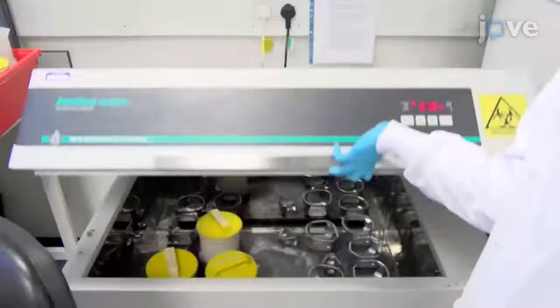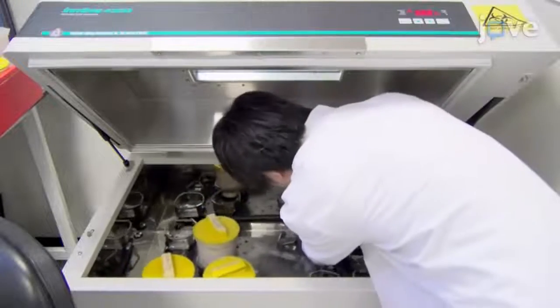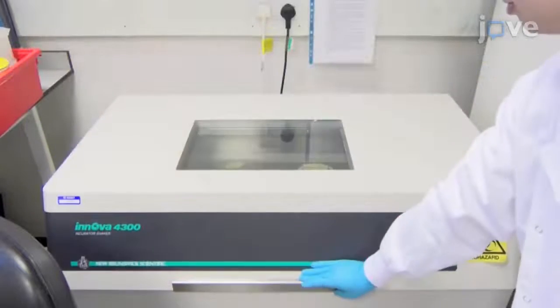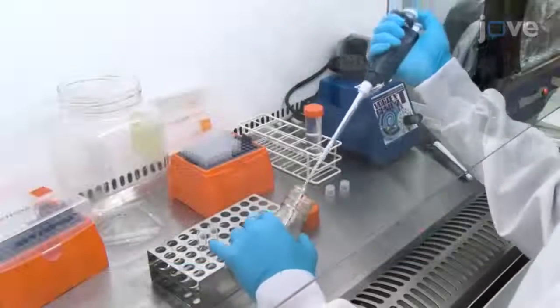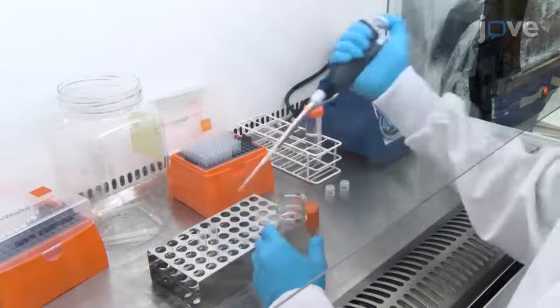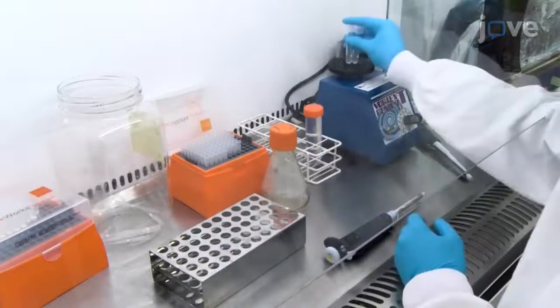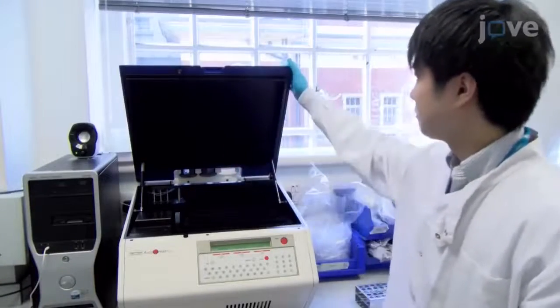Place the flask in a sealed biosafety container and incubate at 37 degrees Celsius in an orbital shaker incubator at 220 RPM for 72 hours. After incubation, prepare 1 to 10 dilutions of the culture in phosphate-buffered saline in luminometer tubes, vortex, and load the luminometer tubes into the luminometer.